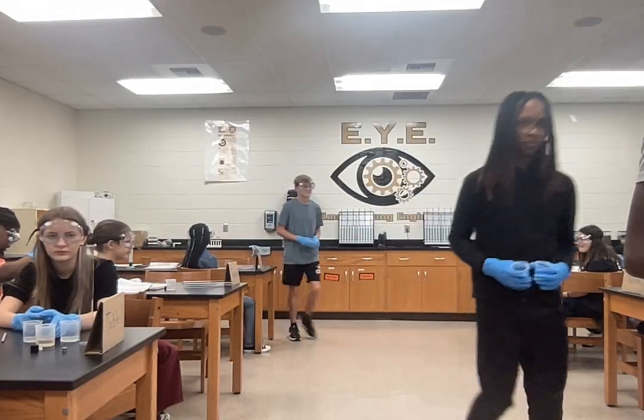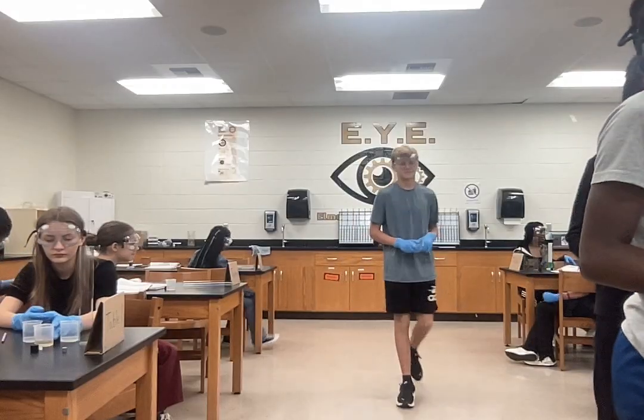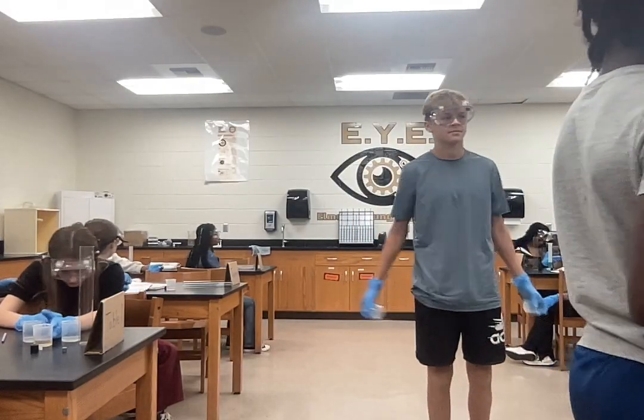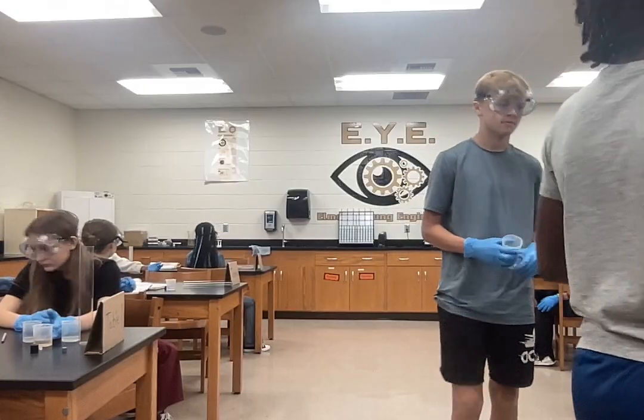Kind of hard to open. Yes. Yes, give me one moment. Don't touch anything until you have some new ones.